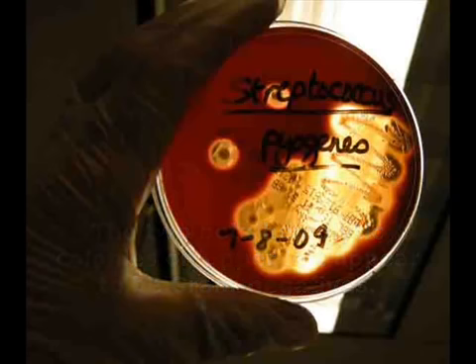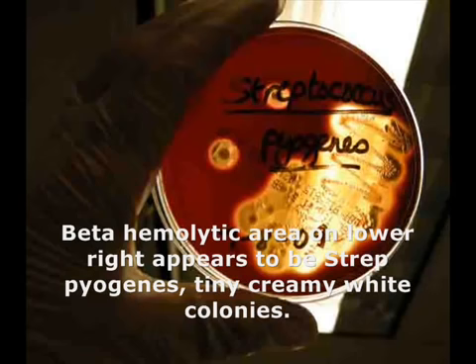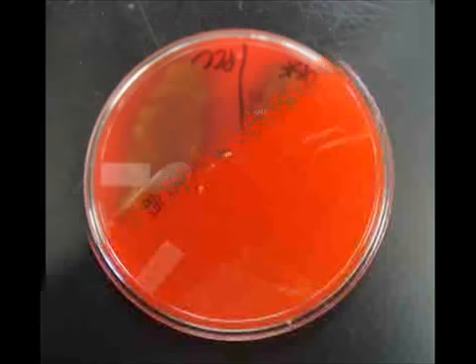On the lower right portion of the plate, you see a large area cleared, and the majority of that area was cleared by Streptococcus pyogenes, which has a colony morphology of very small, creamy white bacterial colonies. Punctiform means very small, round. Beta hemolytic colonies.